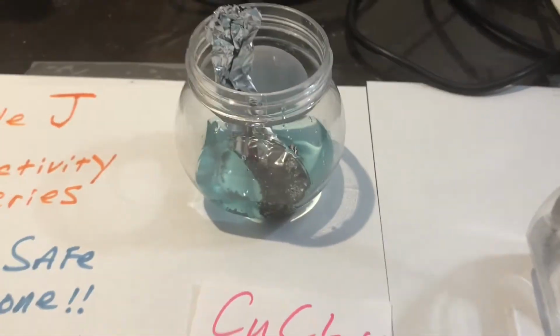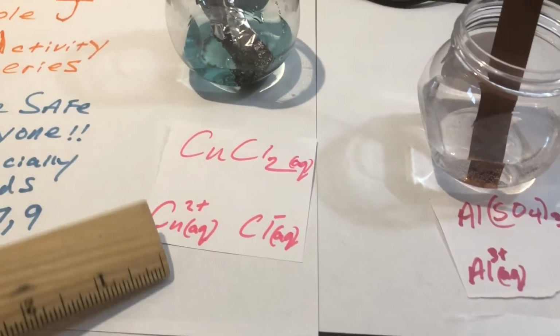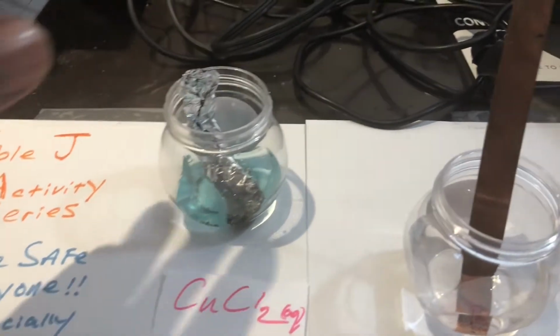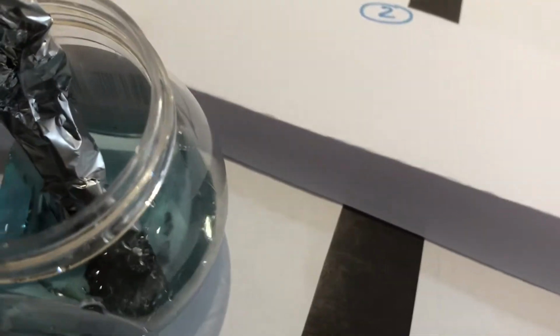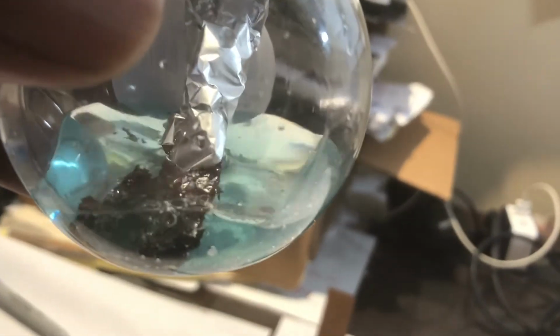Let's go to the second situation, situation number 2. What was situation number 2? It was the copper ions in solution, right? But this time we put aluminum inside of it. So let's bring it over here for a second. First, aerial view. Now guys, can you see anything floating around inside on the sides of this small container? Let me hold it up a different way. I'm swirling it. I'm going to put the camera a little closer. Do you see anything around the bottom there?